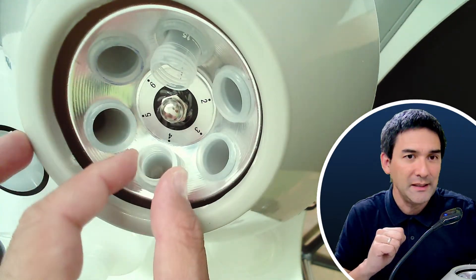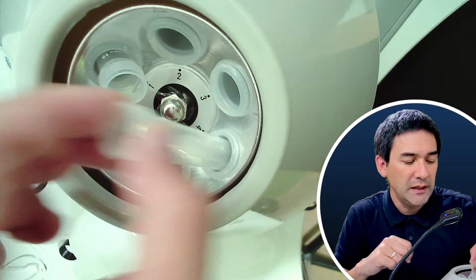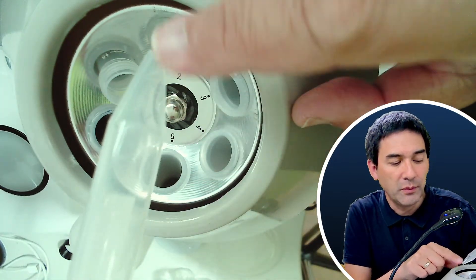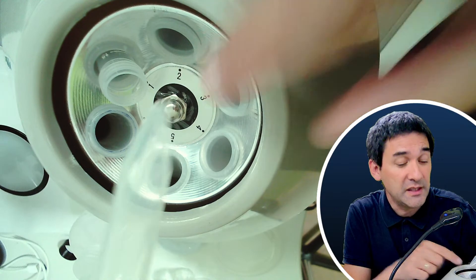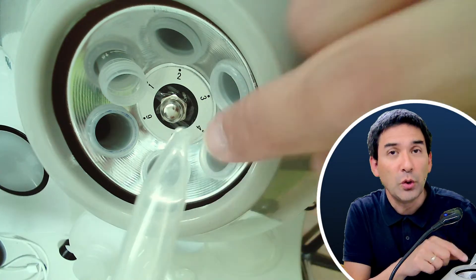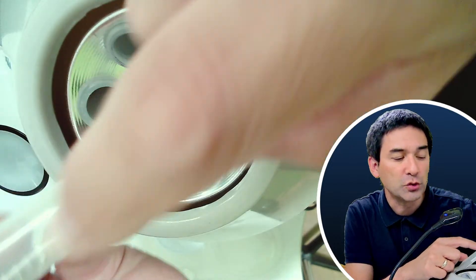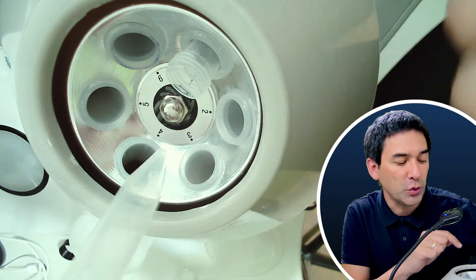You put the tubes in with a sample — it always has to be properly balanced — and when you turn it on it spins very quickly. All of the solid particles will start to settle down to the bottom. I remove the water on top, and then I can put the so-called pellet collected at the bottom under the microscope. The reason it works is that spinning creates a very large G-force, and everything solid is pulled down the tube.